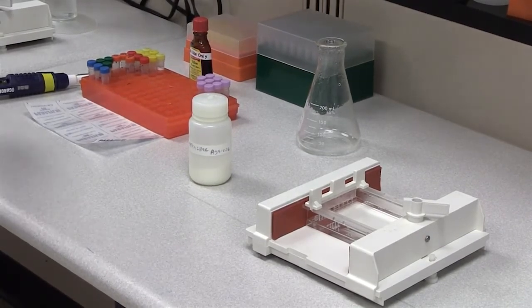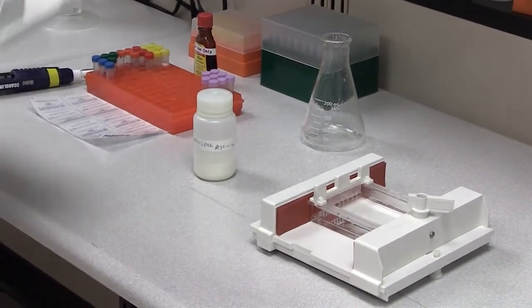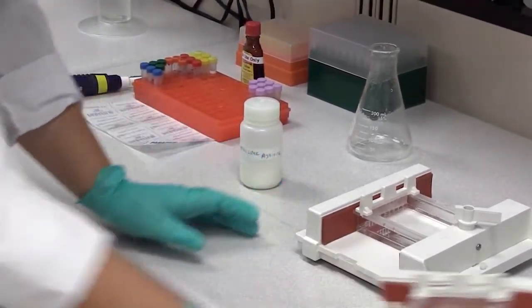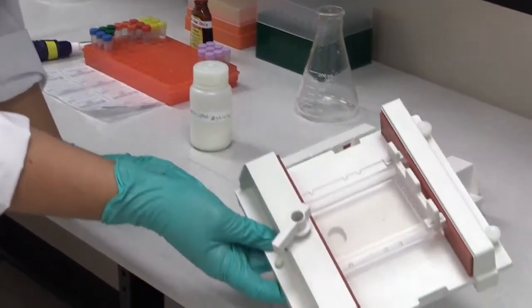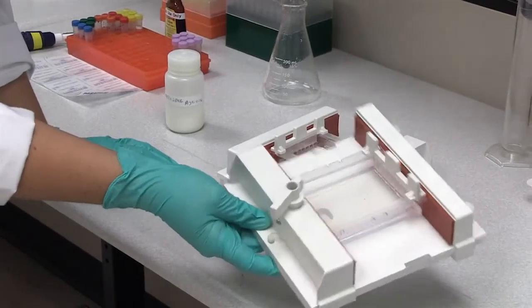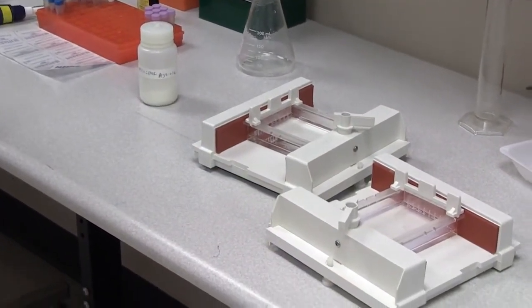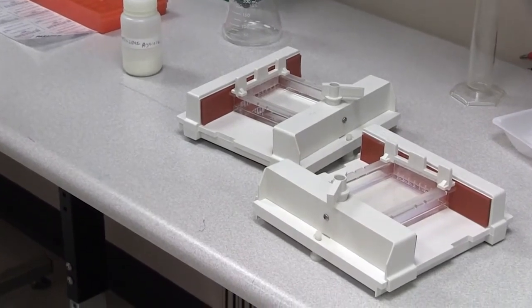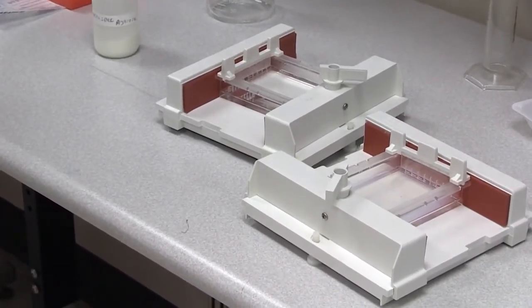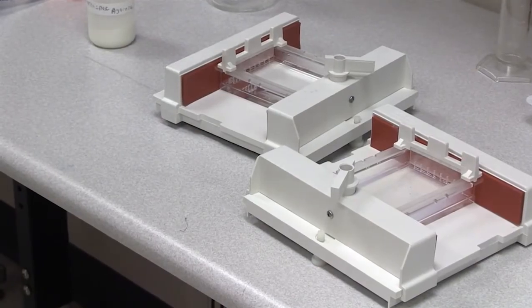Just like a cooking show, we already have one that's done. You can see this gel is opaque in nature. It is firm and ready for us to use so that we can load it into our electrophoresis chamber, add the buffer, and start adding the dyes that we are going to run today.